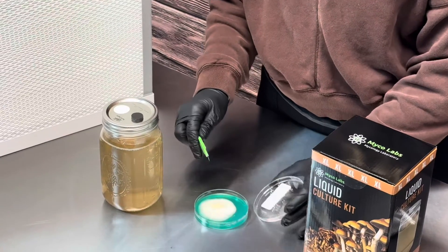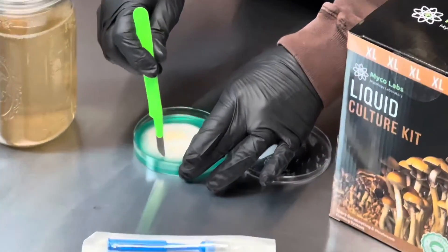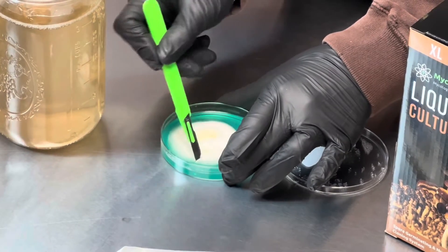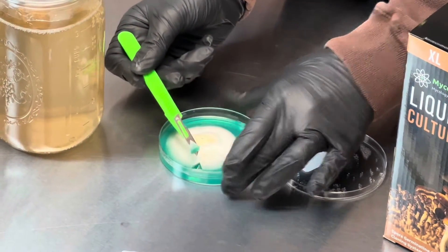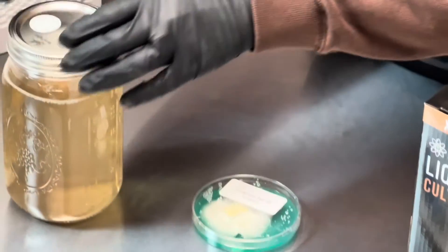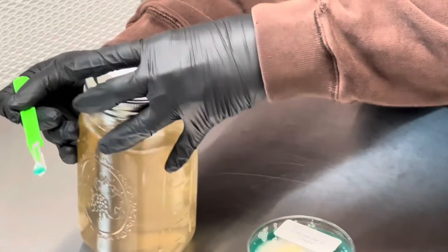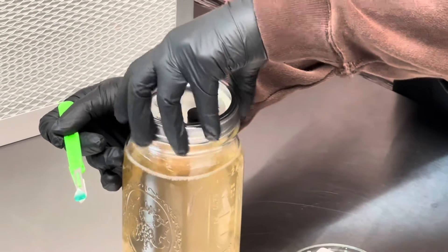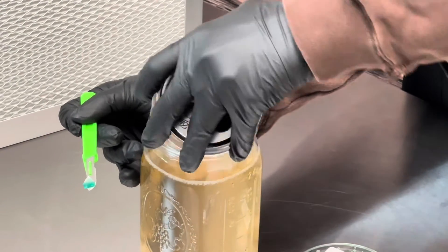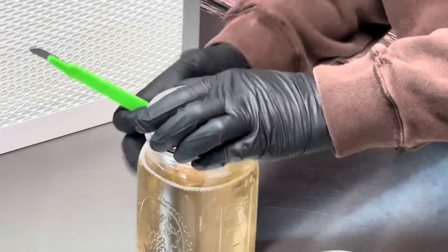Open the plate and take a section that has the most new growth. Cut a little triangle out, lift it up using the scalpel, and since we're under the flow hood, open the jar quickly, tap it in, and close the jar.